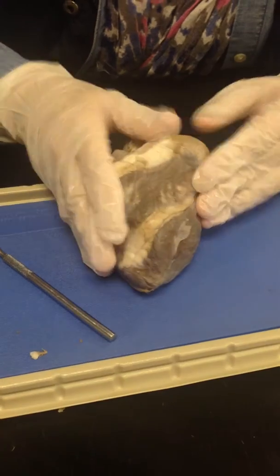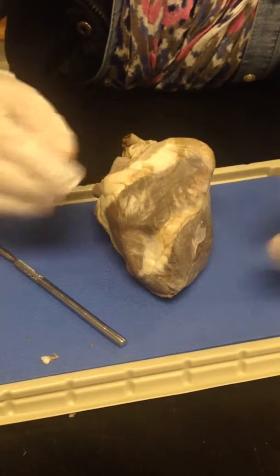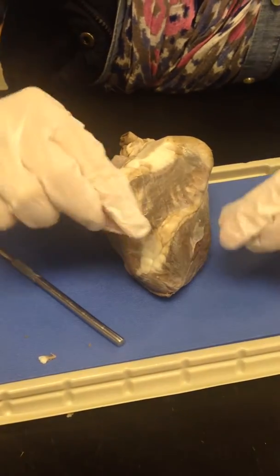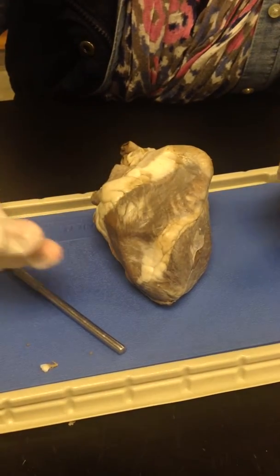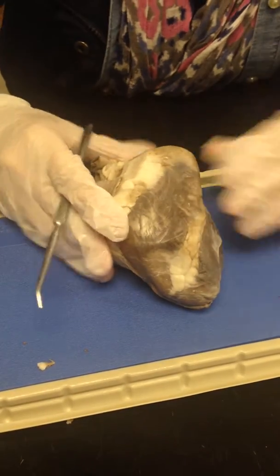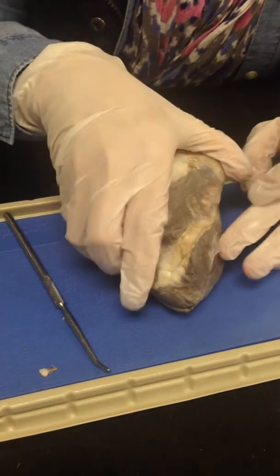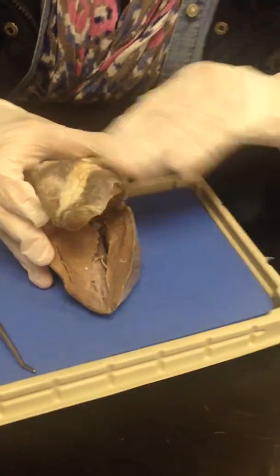If we had a normal heart, it would have the pericardium around it. That is a much harder lining or sac, you can call it, that protects the heart from friction with structures like the lungs, so it won't rub against them, right? So now let's cut the heart in a frontal plane view, so every time we open it, it's like up and down, or anterior and posterior.